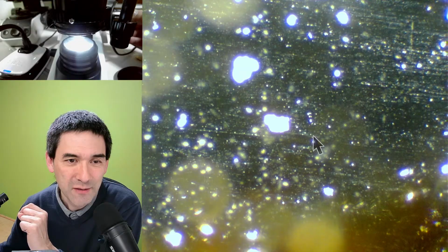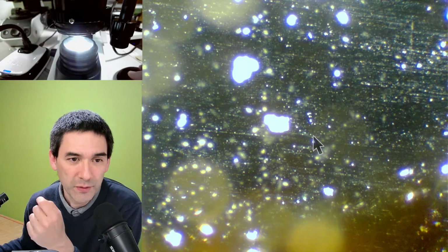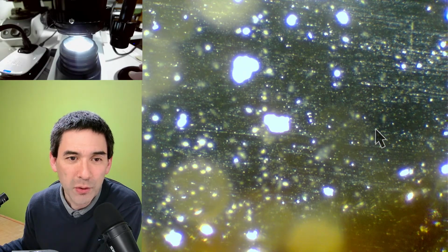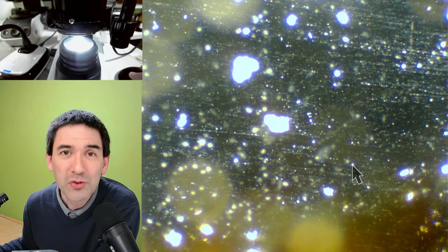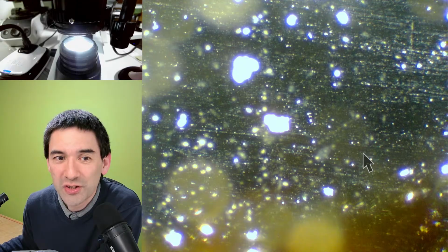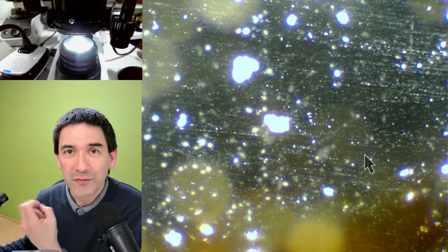But what this basically means is the following: because it is so sensitive to dust and tiny particles, what you're able to see, for example here, are those little dots, the dust particles. It could be that some of these dots are actually much smaller than they appear, but you're still able to see them. So theoretically, it is even possible using dark field to see viruses. But you will not be able to see the structure of the virus. You're just going to see some kind of a bright spot, which is actually larger than the virus. That's because of the increased contrast.